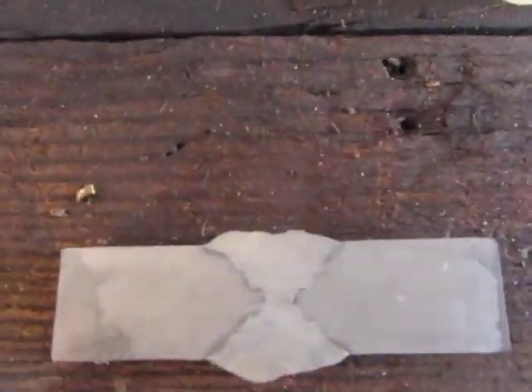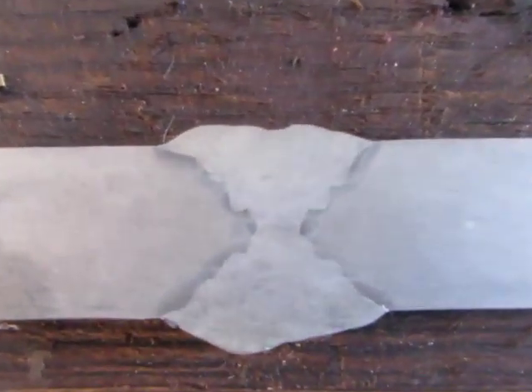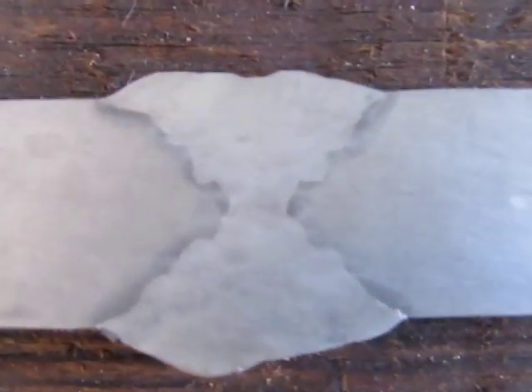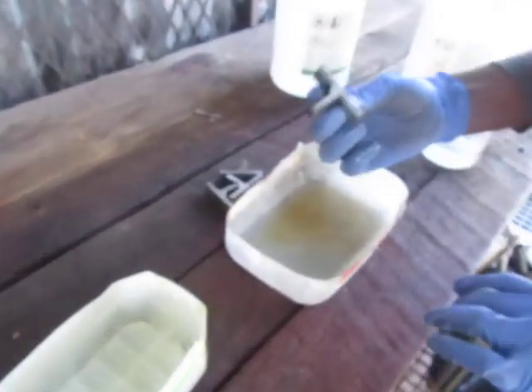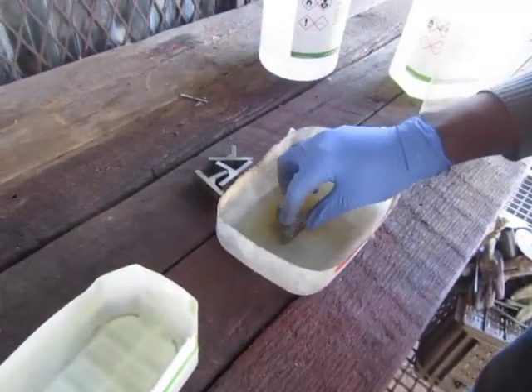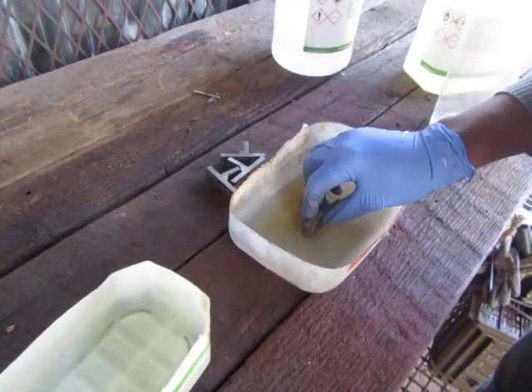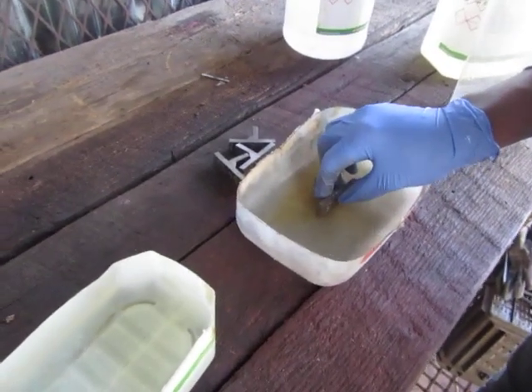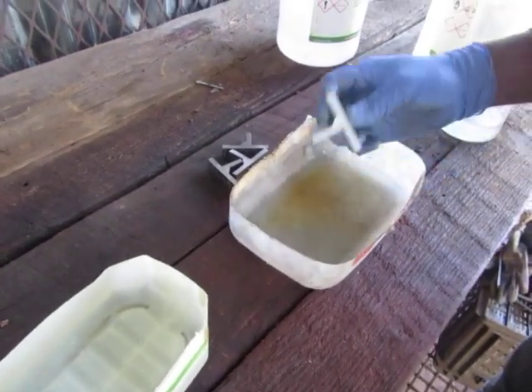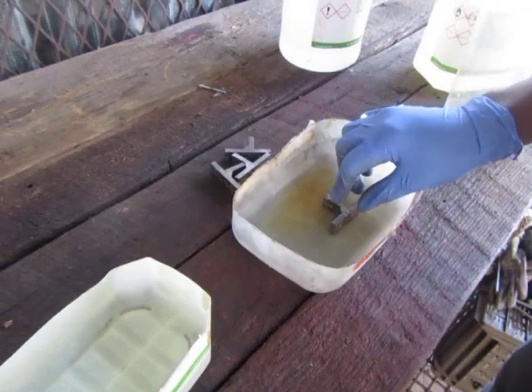There we go! So now I'm doing the same for this fillet weld that I'm having here, and then from there we're going to see how it looks.